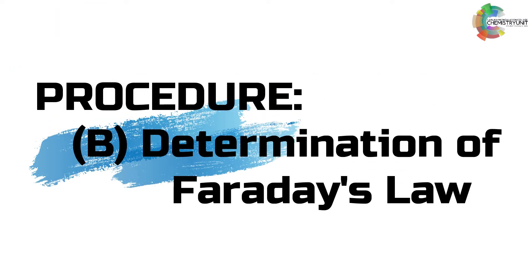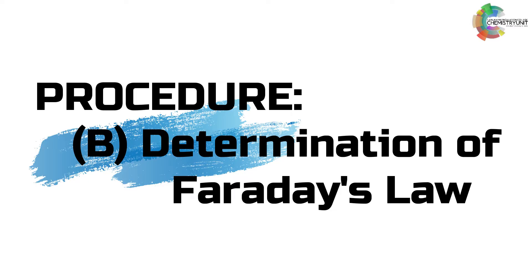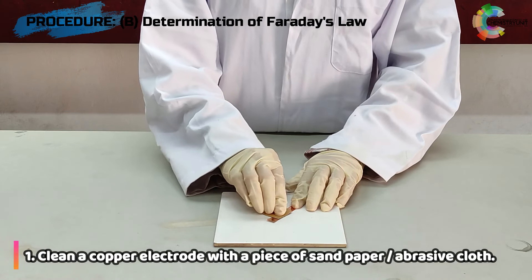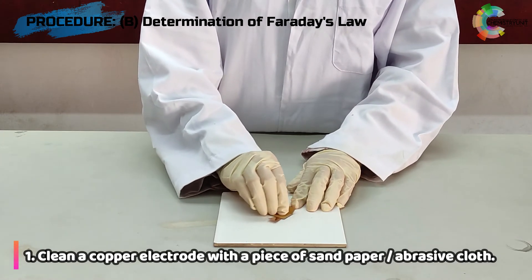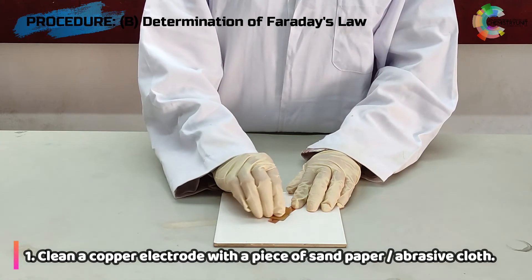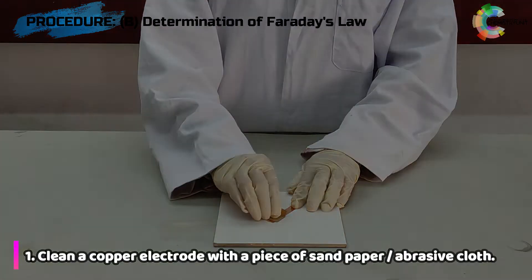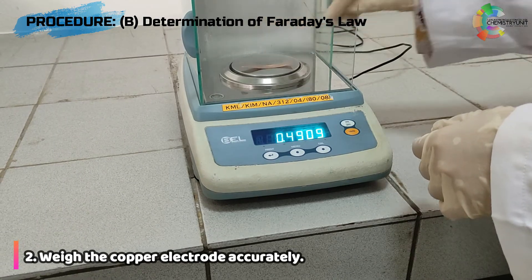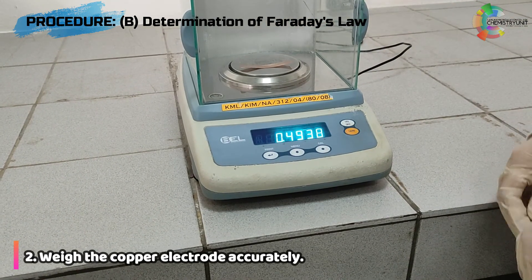Now let's have a look at the procedure for Part B: Determination of Faraday's Law. First, for Part B, you have to clean a copper electrode with a piece of sandpaper or abrasive cloth. Then weigh the copper electrodes accurately using the analytical balance.